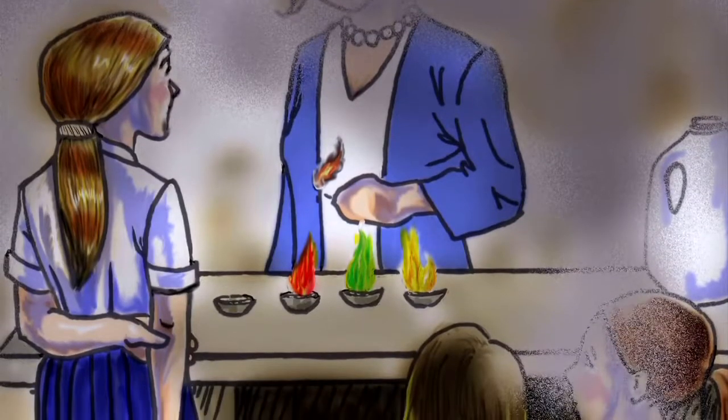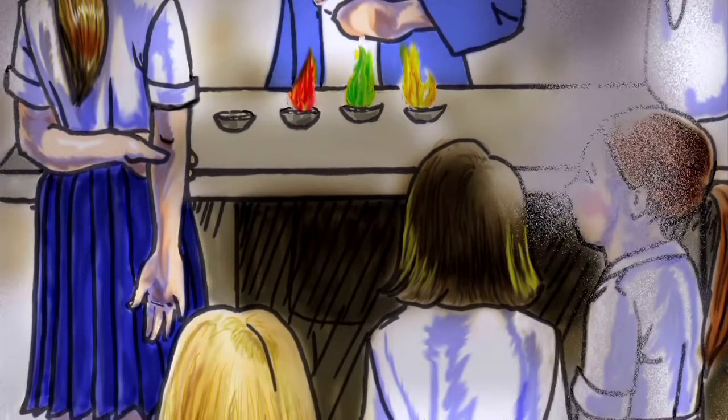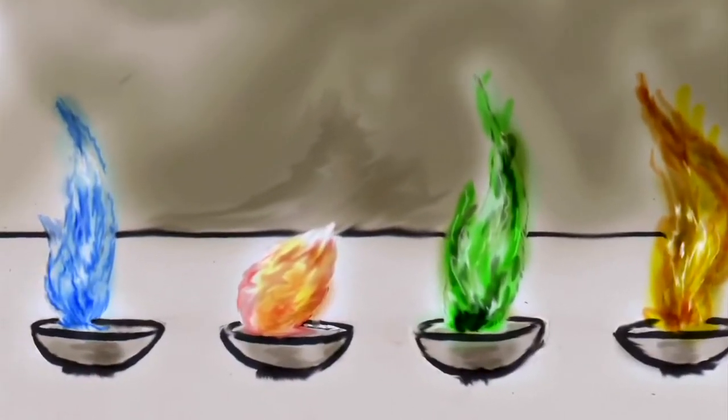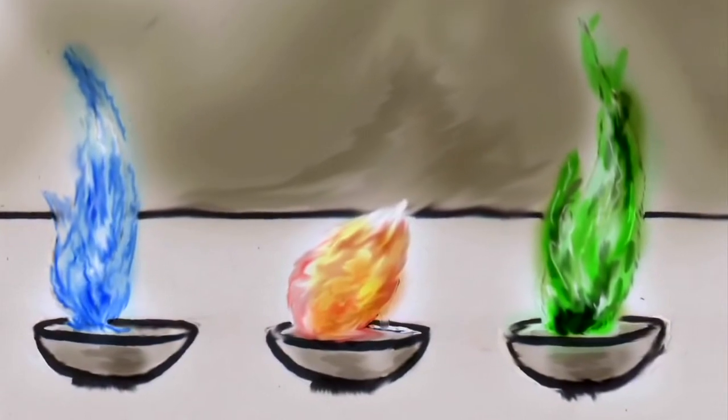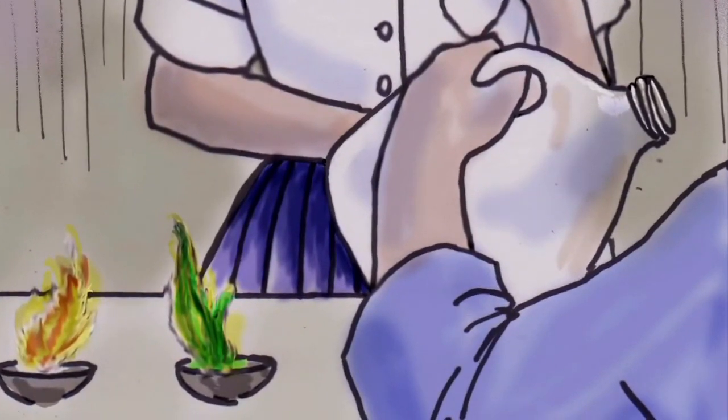She had told us that when she did demonstrations, we didn't need to wear our safety gear. So no aprons, no goggles. And she performed it on her desk at the front of the classroom instead of one of the hoods. Not even a couple minutes into the experiment, the red flame began to diminish a bit. And in the sink, there was a gallon-sized jug full of clear liquid. And none of the students knew what it was. But she took it out of the sink and uncapped it and said, "I better be careful or the bottle will explode." And poured it onto the open flame and it exploded.